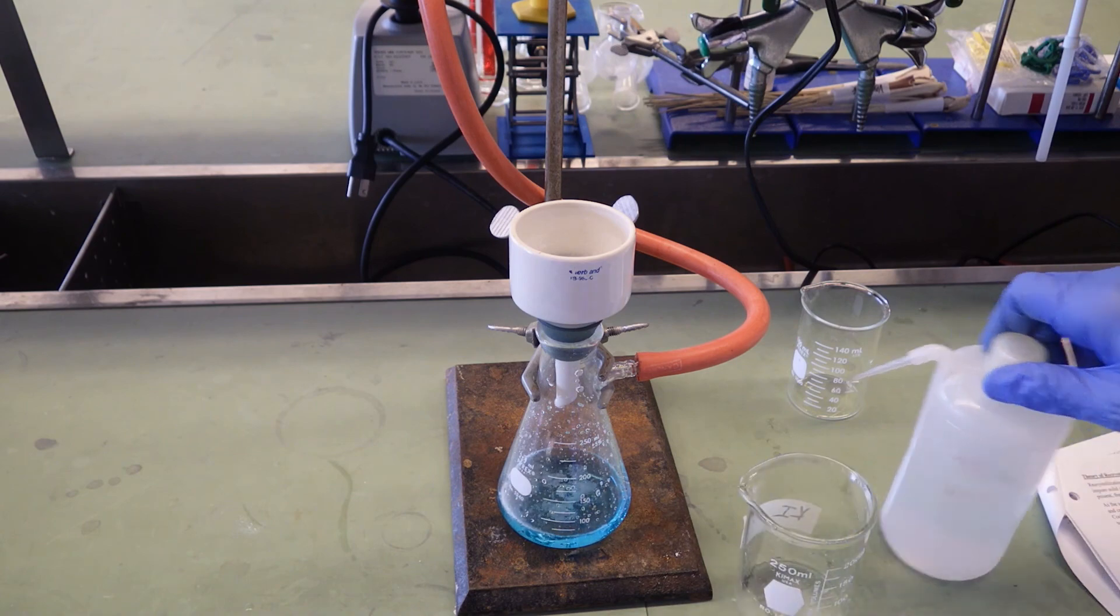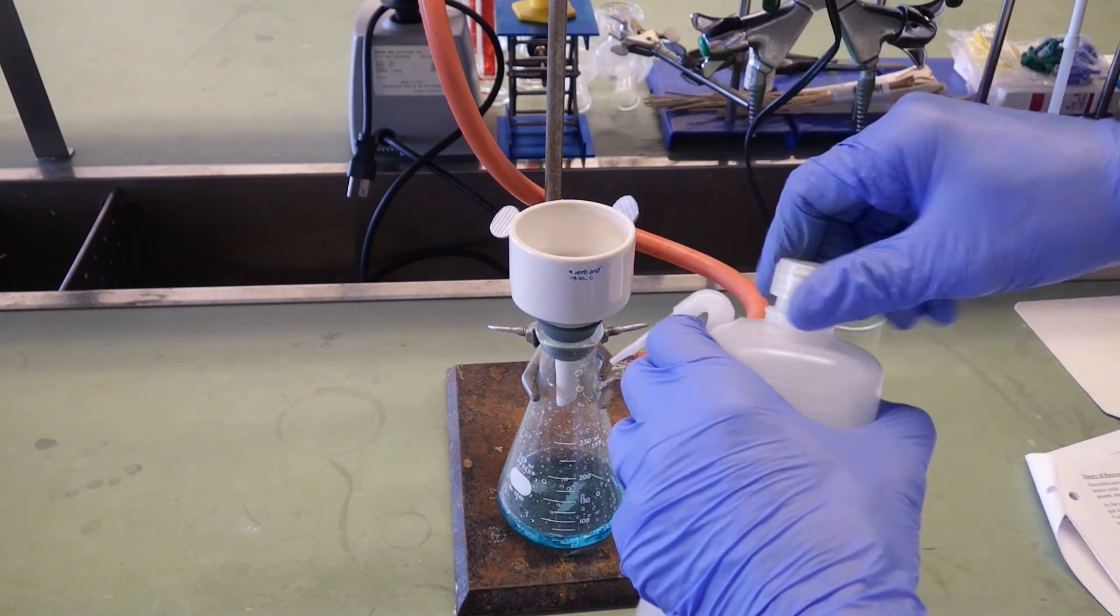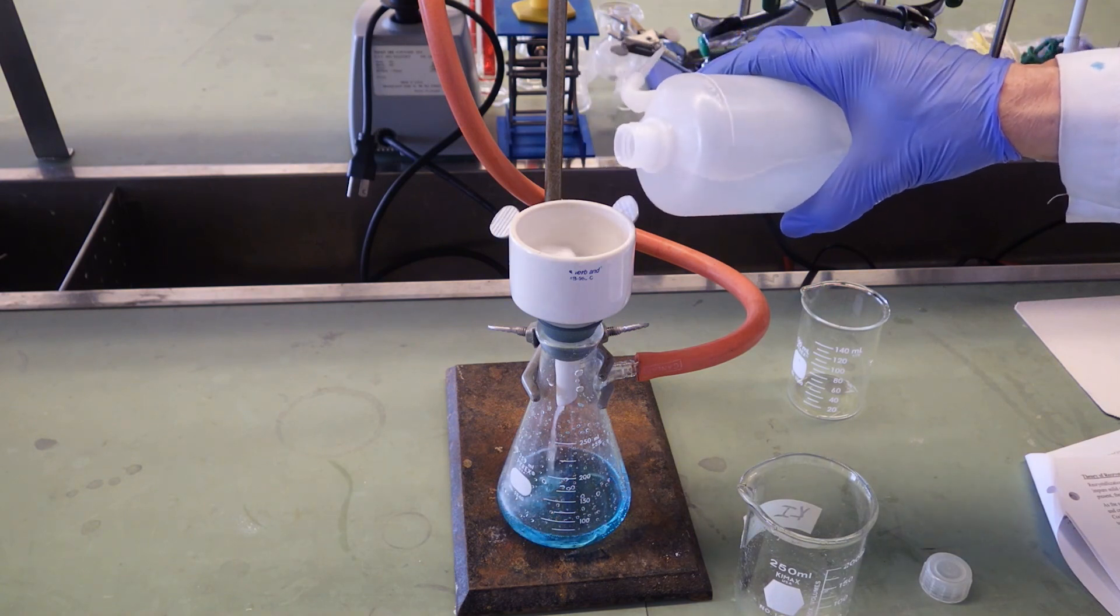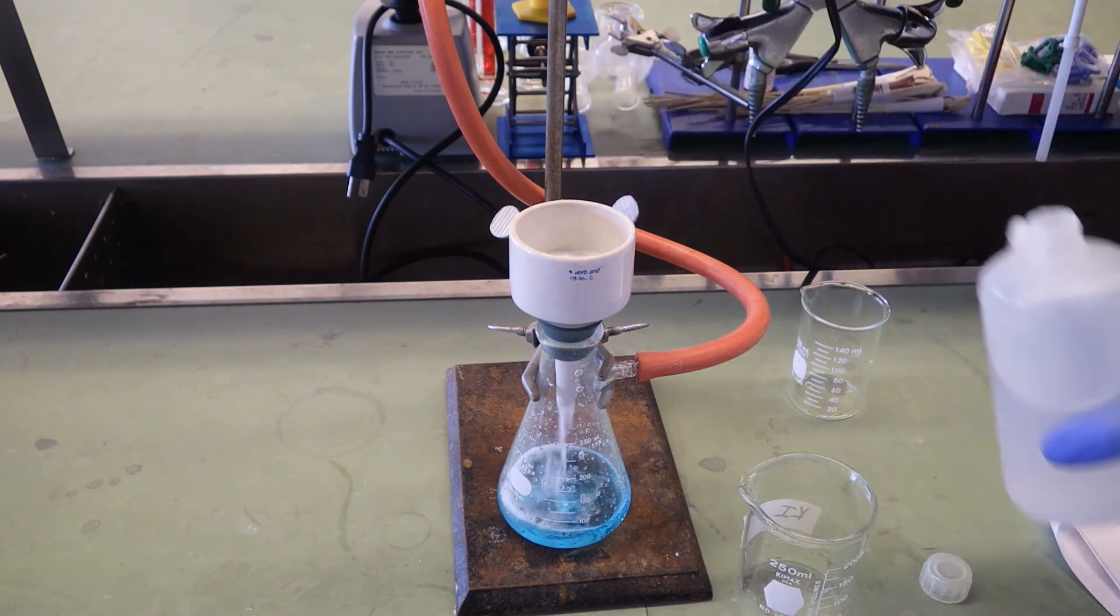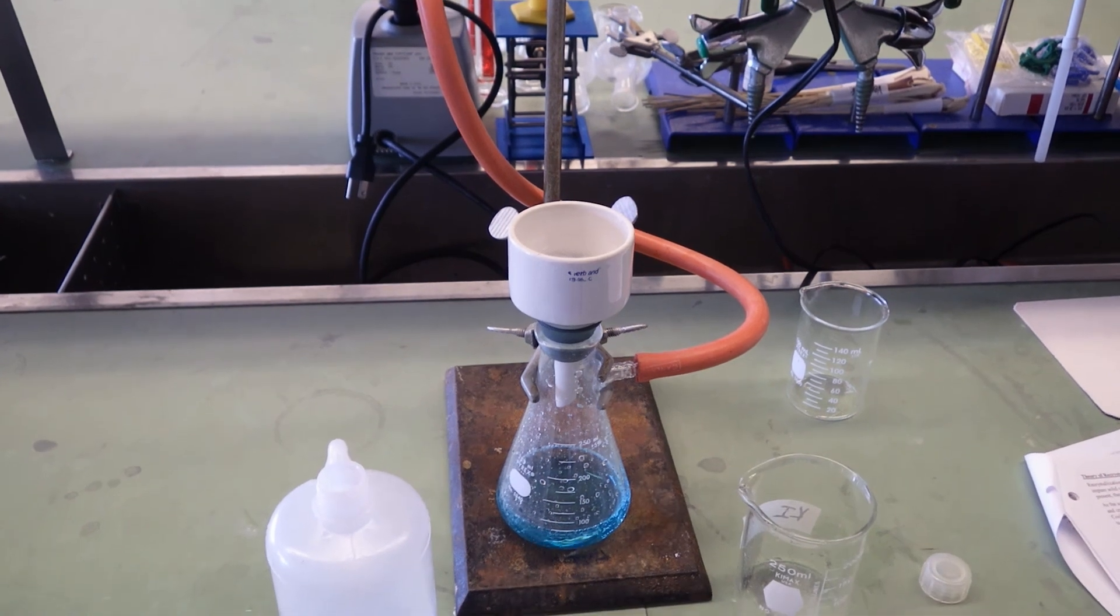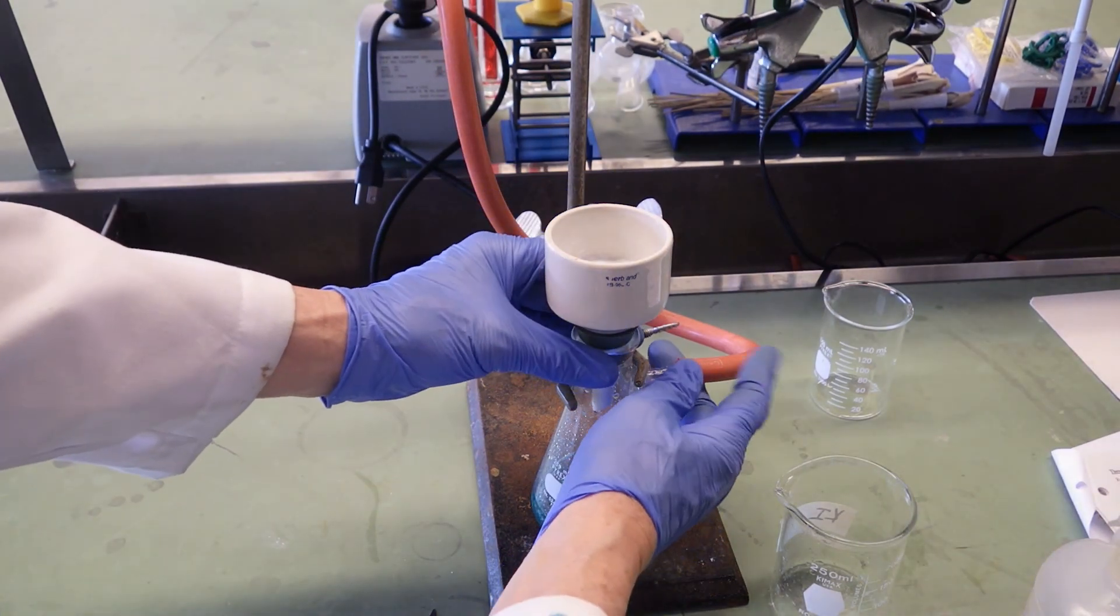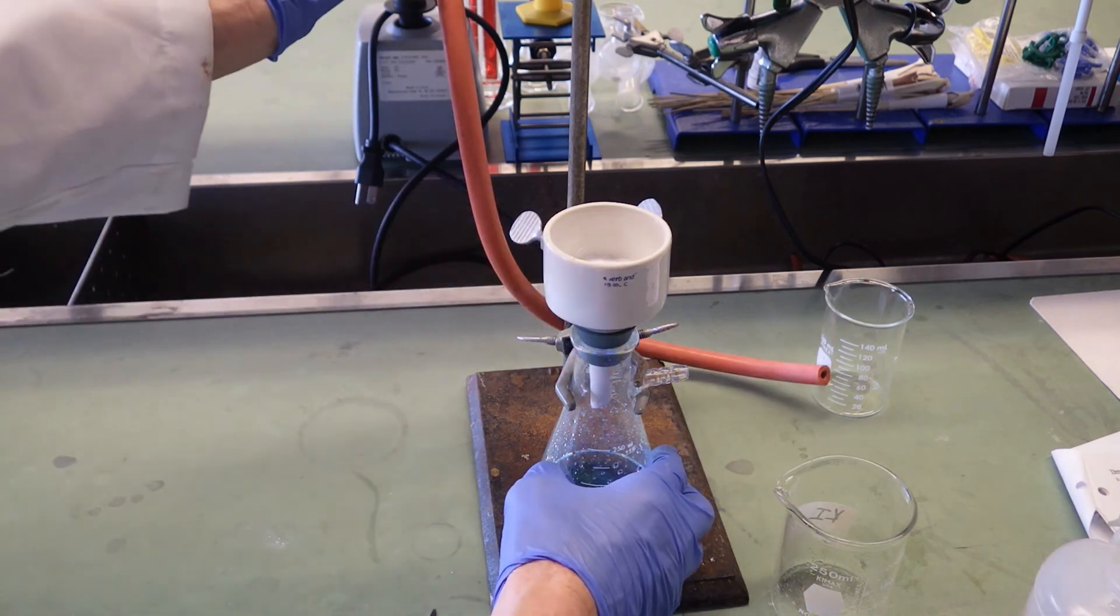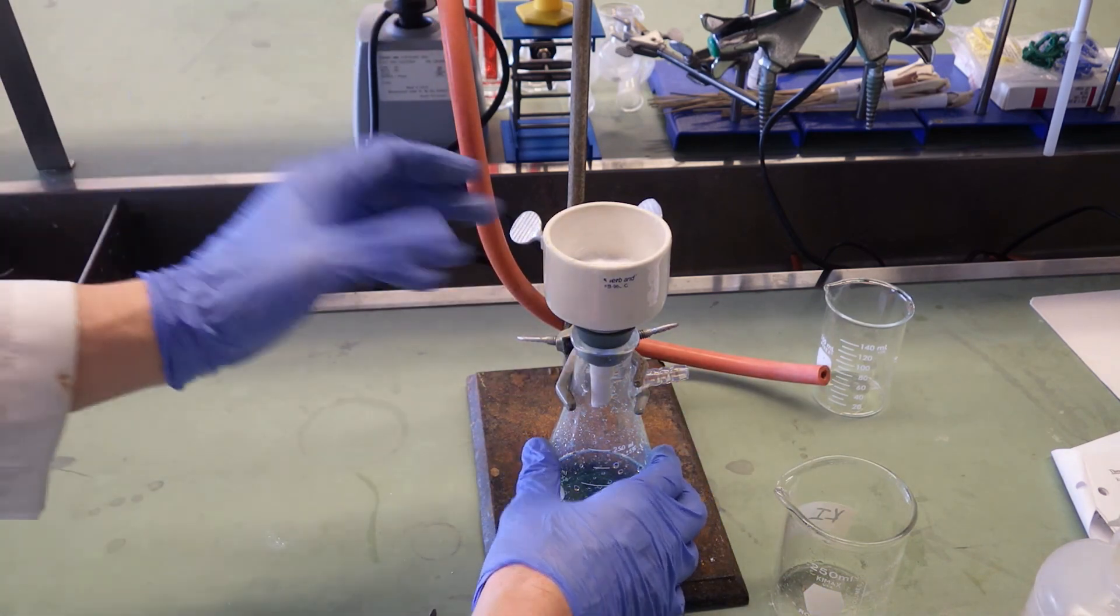Notice I'm going to take the lid off the wash bottle. Don't spray it; rather pour it over the entire surface. It's the best way to clean a precipitate. All right, so we got to release our vacuum. I would normally close the valve first, but I just want you to hear the suction on that line.